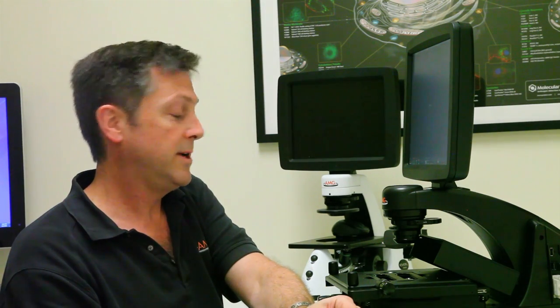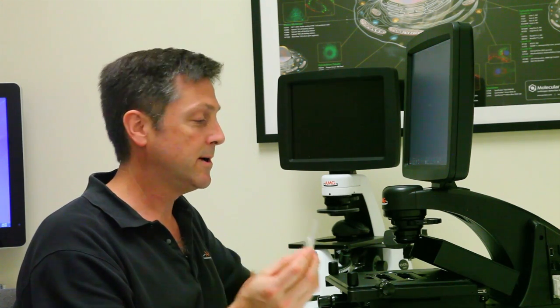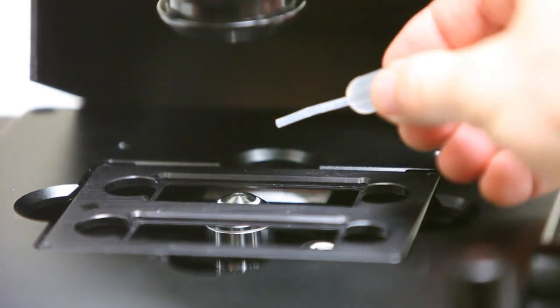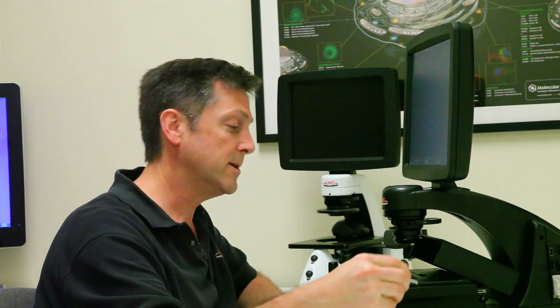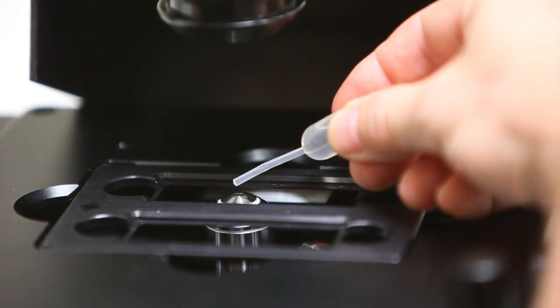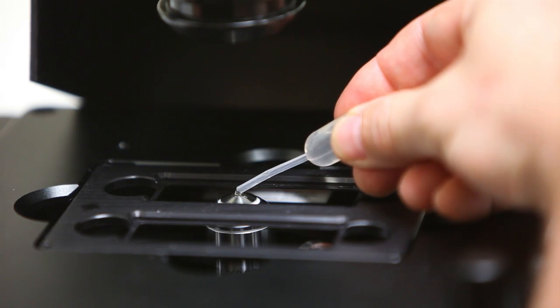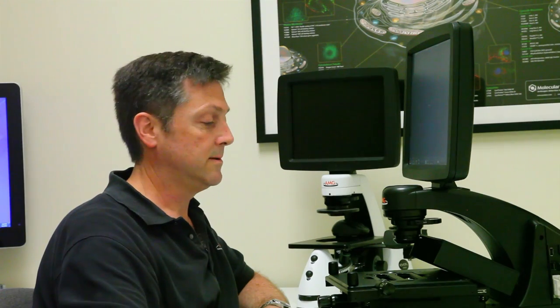And now I'm ready to oil the objective. For that, I'm going to use this little pod that I created before. It's that little ampule full of oil. And I'm just going to bring this over and I'll take a little bit of the oil off here and blot it into this napkin to get any kind of air bubbles out. You want to be very careful not to have any air bubbles in the oil. So once I do that, I'm going to bring it here and just apply a very small drop right there to the end. That's all we really need. And I'll set that aside.